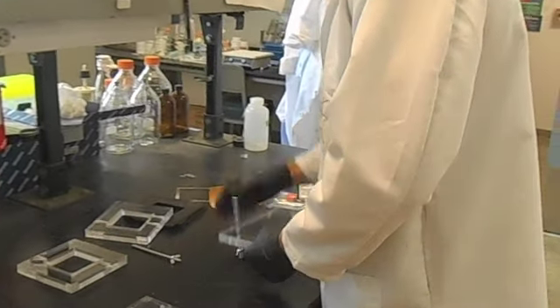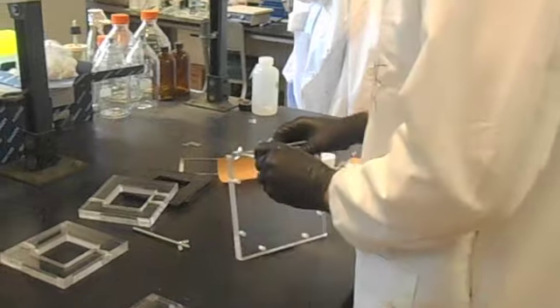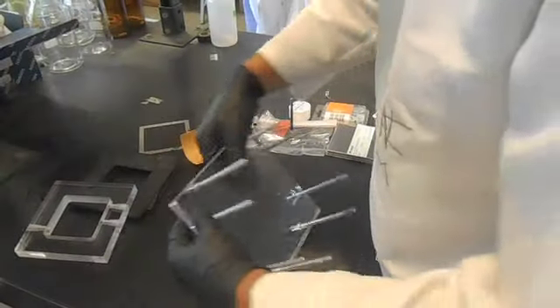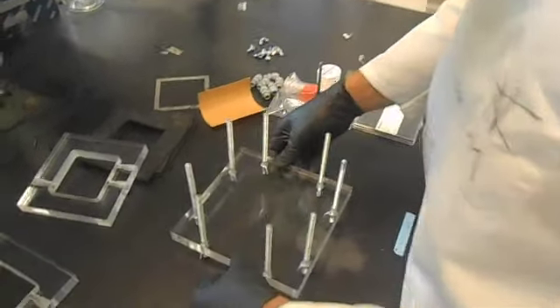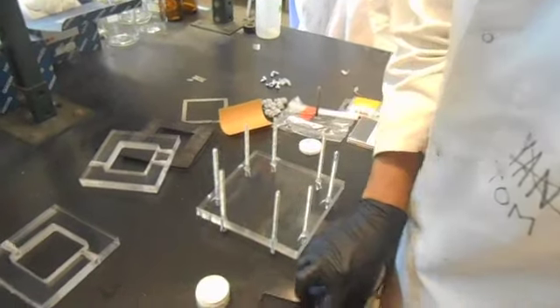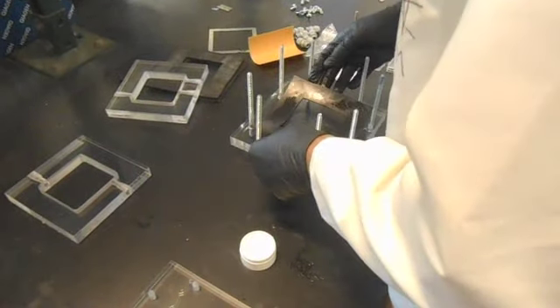Start by placing the threaded rods into the cathode exterior frame. Make sure that the washers and wing nuts come down to the same length on the threaded rods to ensure a flat, level frame to construct the remainder of the cell. Take one of the rubbers and coat it with a thin layer of silicone grease on both sides and place it in the center of the exterior frame.